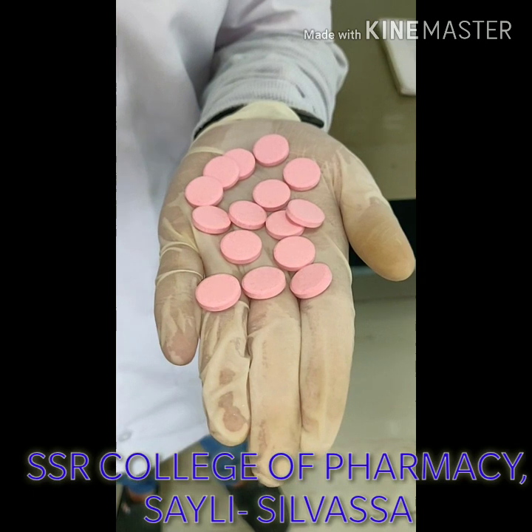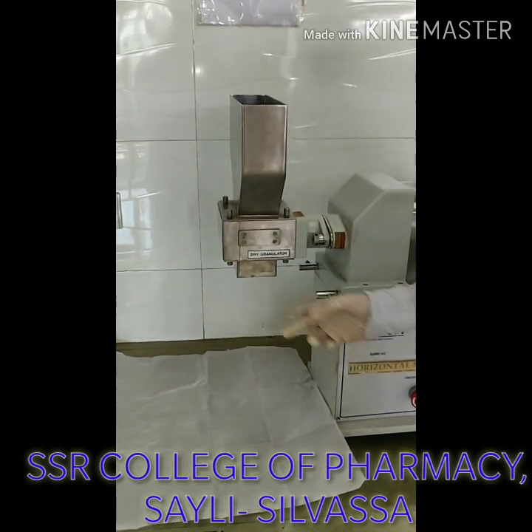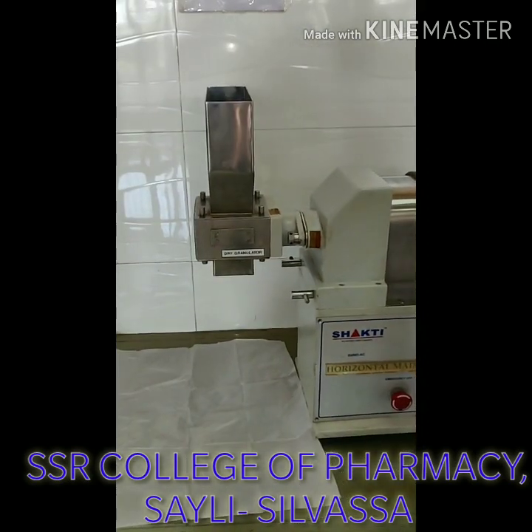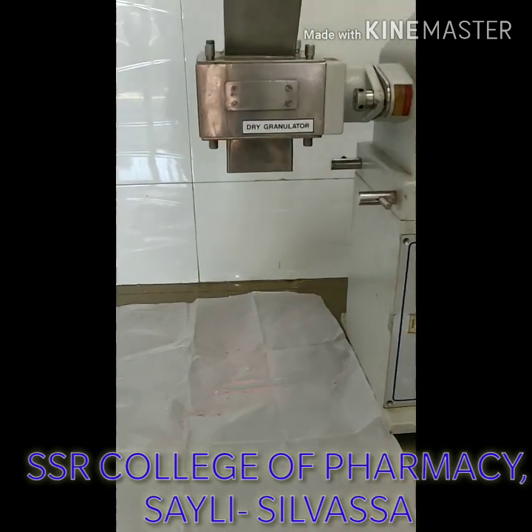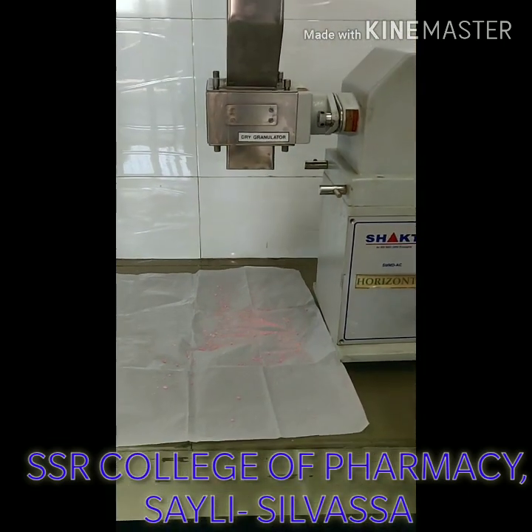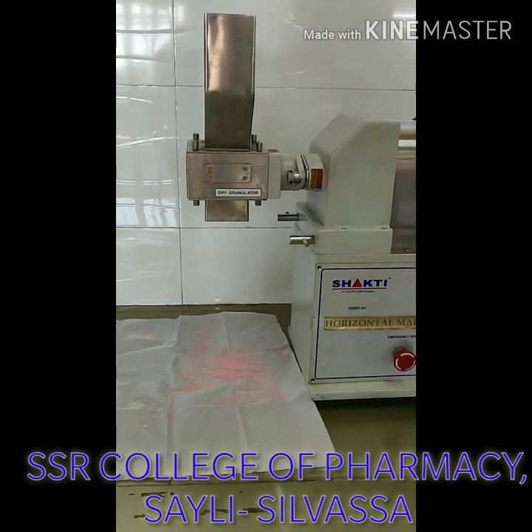These are some slugs which I have prepared to show you the working of the dry granulator. This is the outlet and this is the inlet. From this the granules come out and are collected in a butter paper. Now I am going to show how it works. When the machine is started, we have to pour the tablets in one by one, and here you can see the granules being produced. This is the end of the process.